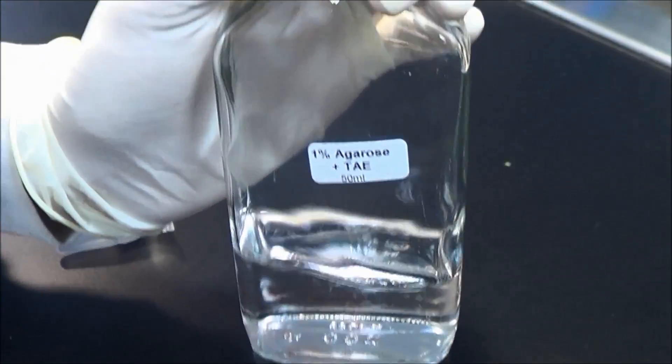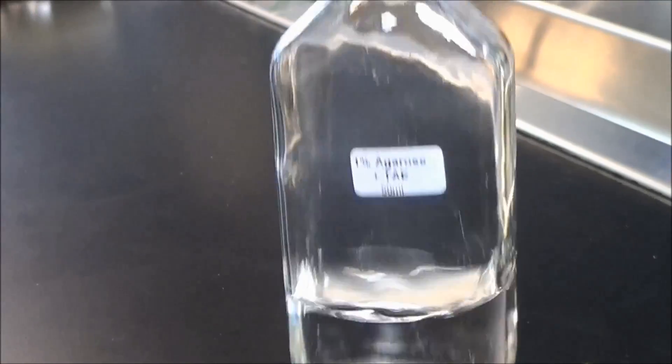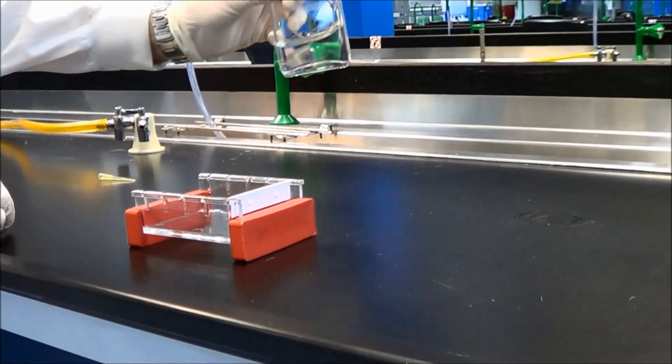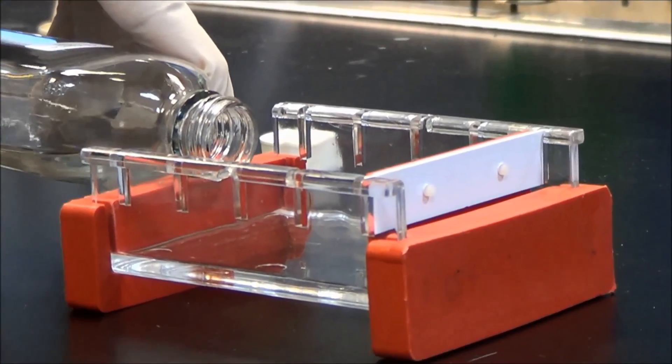Mix by gently rocking, do not shake. Make sure the agarose is cool enough to handle, then pour the molten agar into the tray.